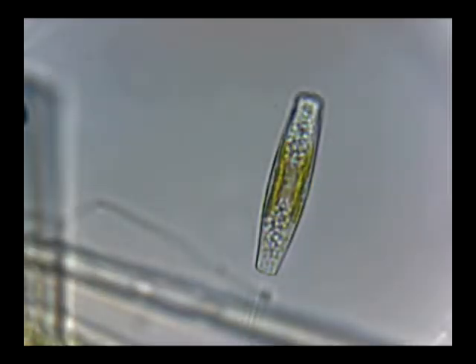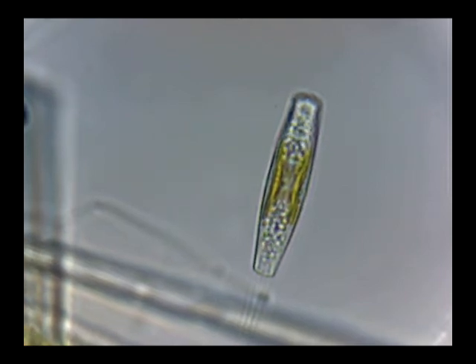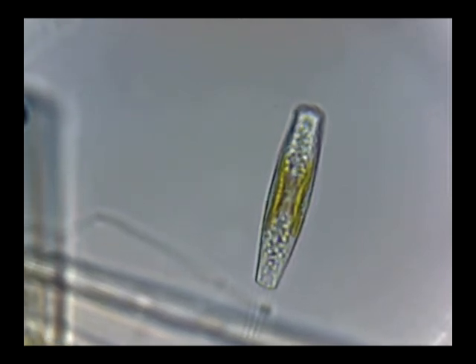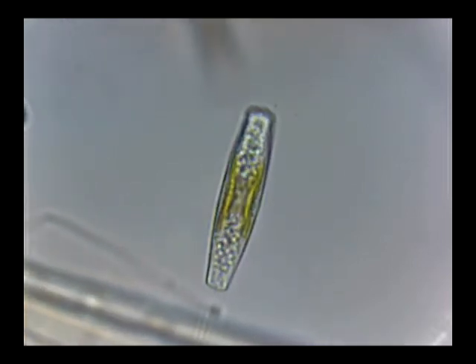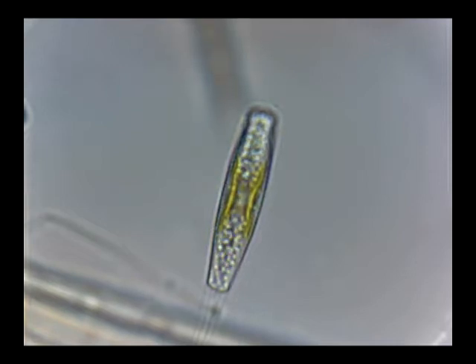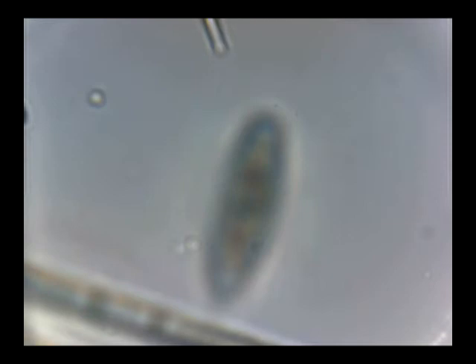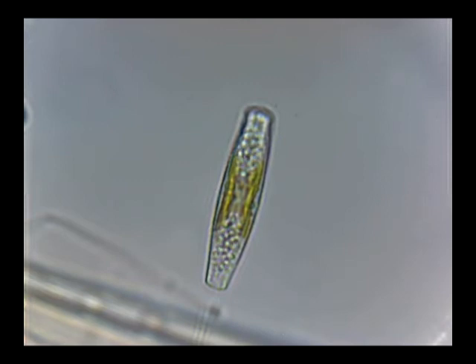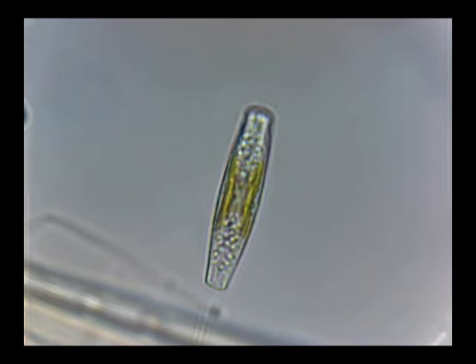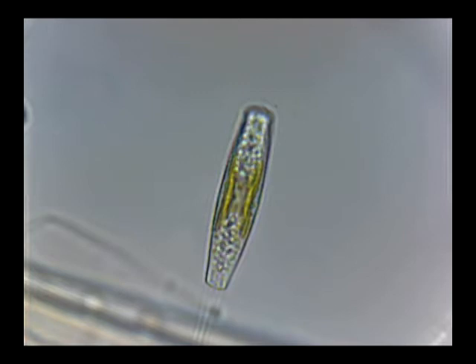Now you can see clearly there's a lot of motion going on in there — see all that? Interesting, because I've not seen this in any of the other diatoms, just this one, and that's why I'm so keen on it. I want to see what's going on in there. Next stop: oil immersion, full blast, very high power. Here we go.